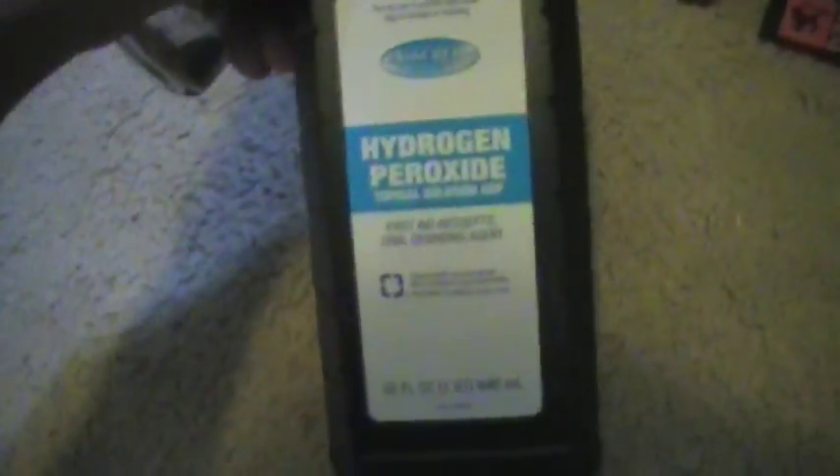I got a little bit of copper — not very much — from a copper pipe. And what you do — I showed you in another video — we mix three percent hydrogen peroxide.